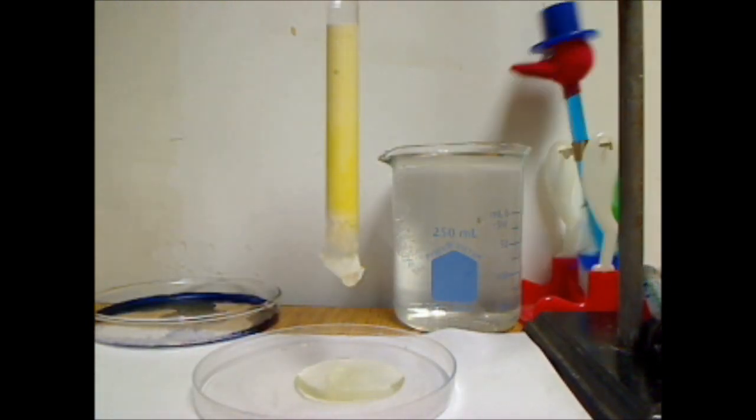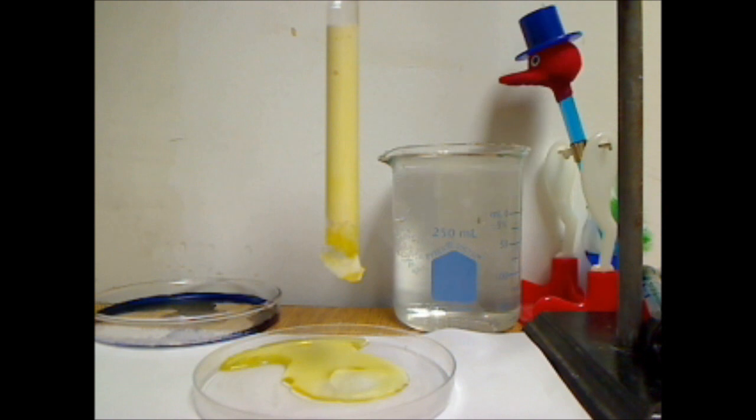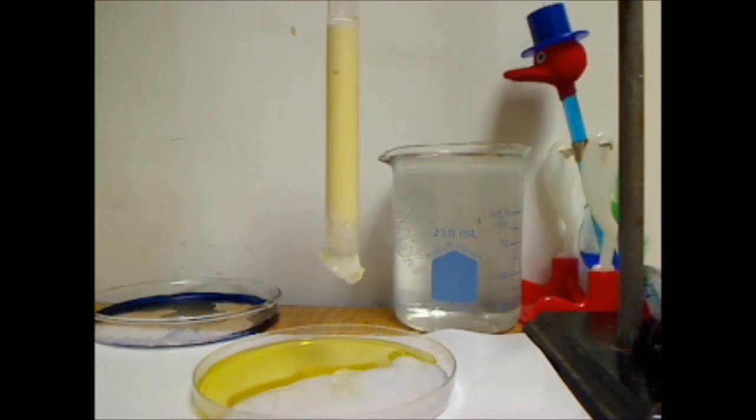Excellent. You can see the yellow color fading and the acetone is taking out the yellow. Column chromatography can be used for bulk separation. That's its main usage.